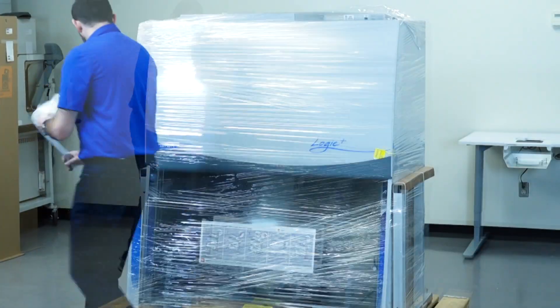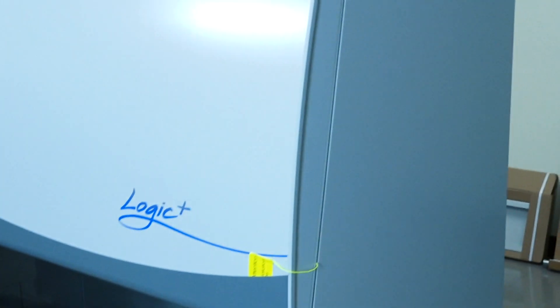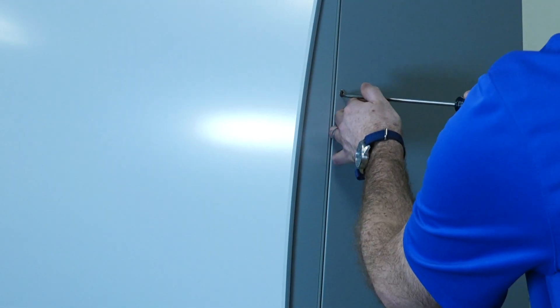If your Logic Plus includes a base stand, set it aside in a safe place until later. If you find anything missing, contact LabConco for assistance.